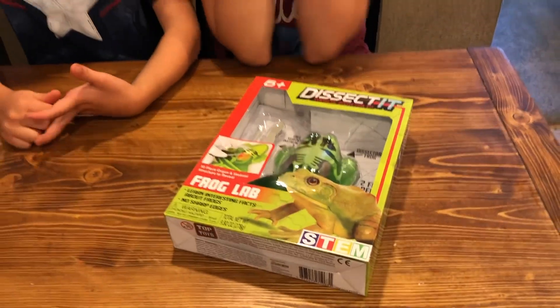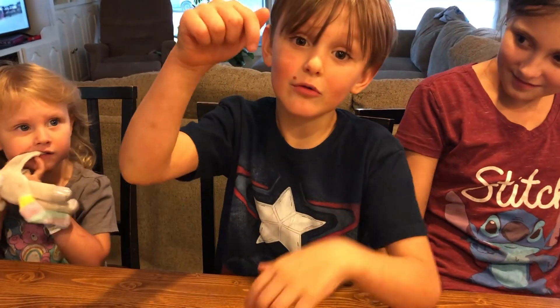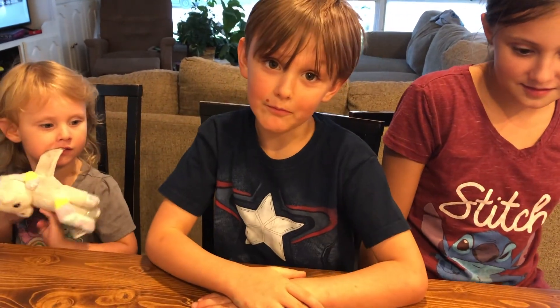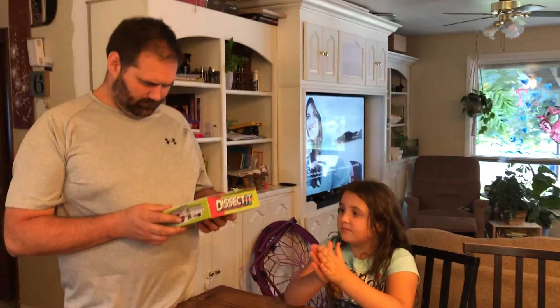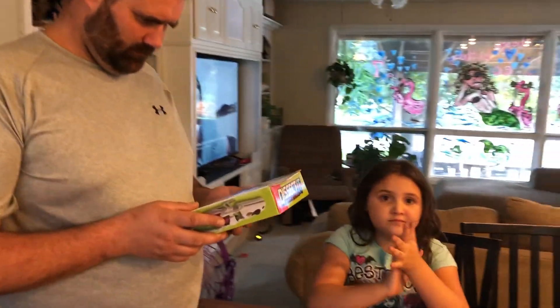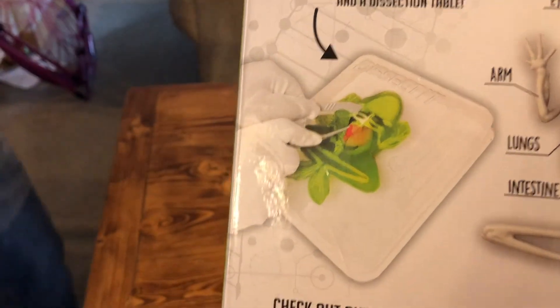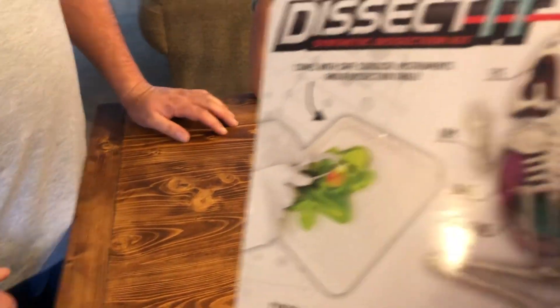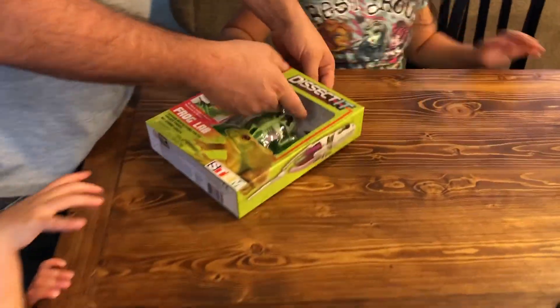Dad's home now so we're ready to dig in. This guy's a button — let's make sure to put that button on the bottom. It's like a little tray and all the tools you need are in here. Jenna, this is ours — we get to chill.